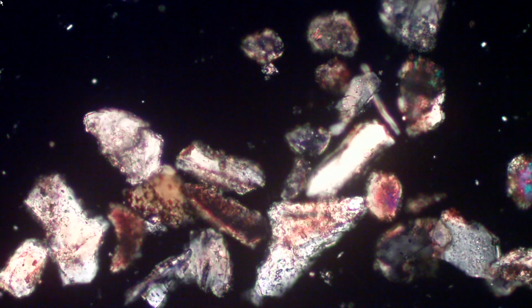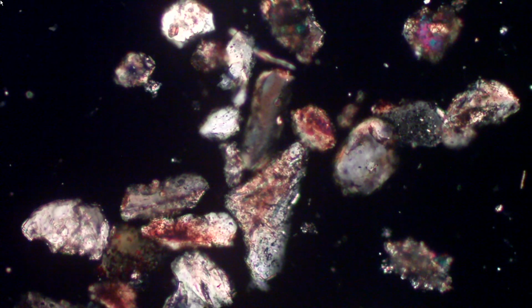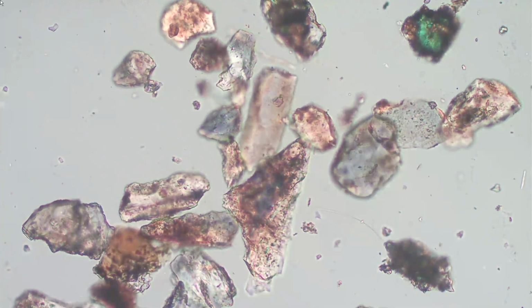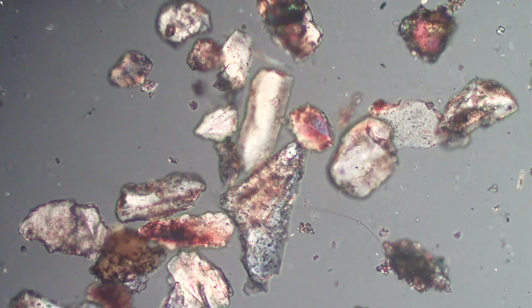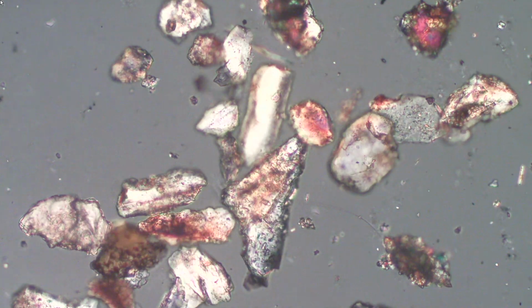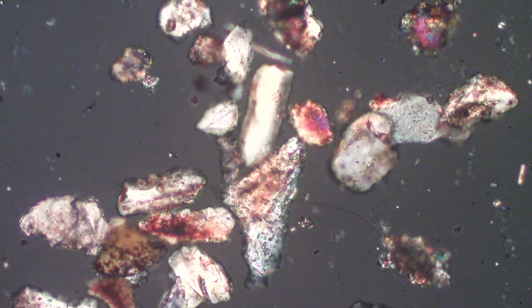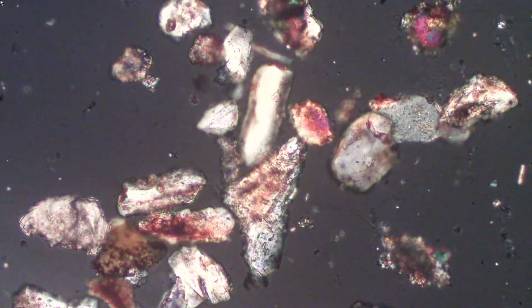There's our particles. Let's rotate them so we've got some in extinction position. That's a good place right there. Okay, now, if we have 5, let's put in our quarter wave plate. There's a quarter wave plate. Now, if we add our slide with the tape on it, there's 4 thicknesses, pretty close to circular polarized. You can see that the ones that were in extinction show up now.